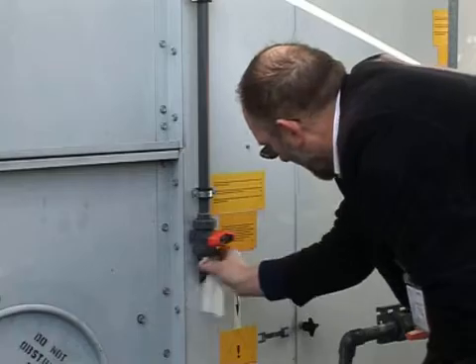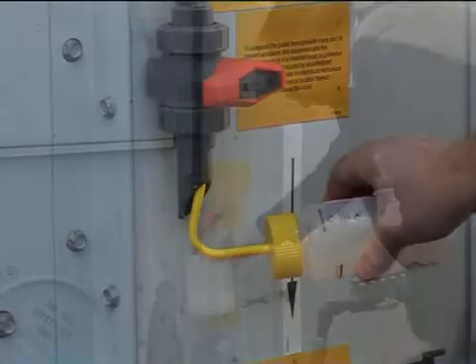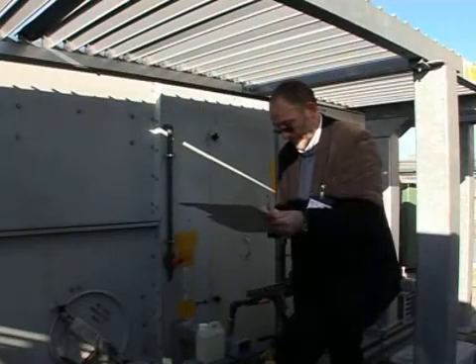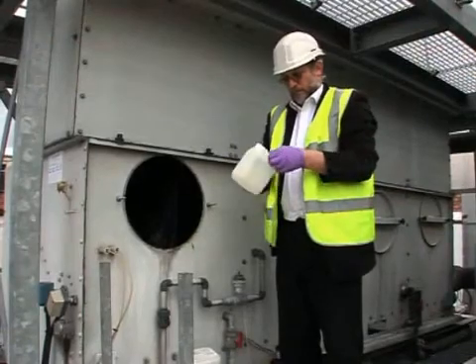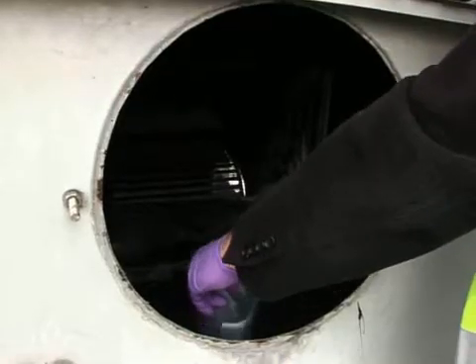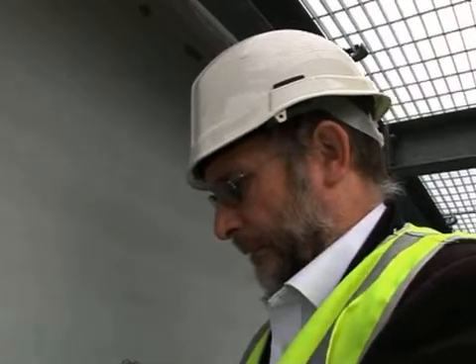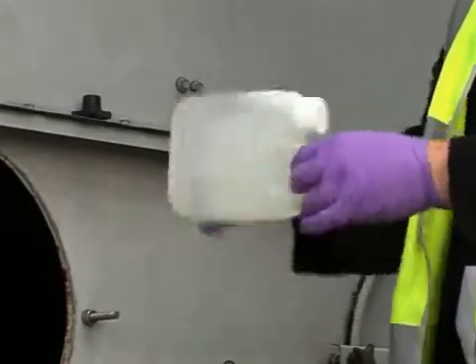There may also be a sample tap on the pond, particularly in evaporative condensers. This should be situated as far as possible from the freshwater inlet. If there are no sample taps, take a dip sample from the pond as far from the freshwater inlet as possible. If the only inspection hatch is close to the freshwater inlet, ensure that freshwater is not entering.